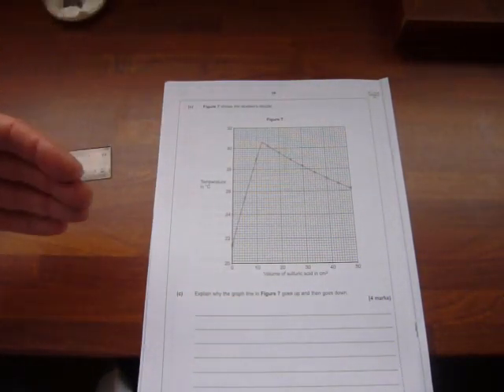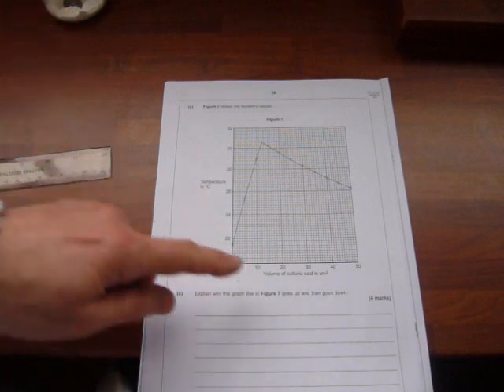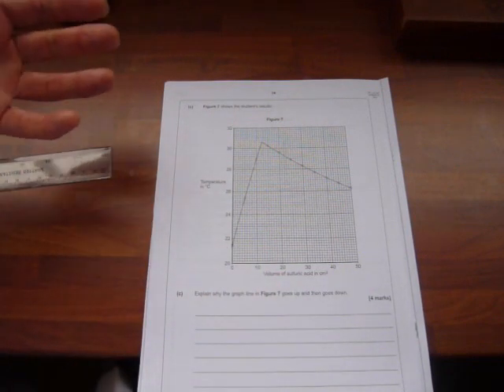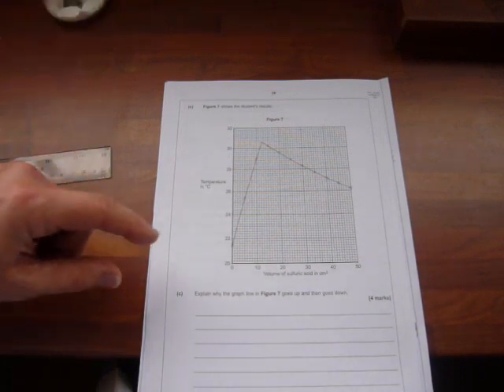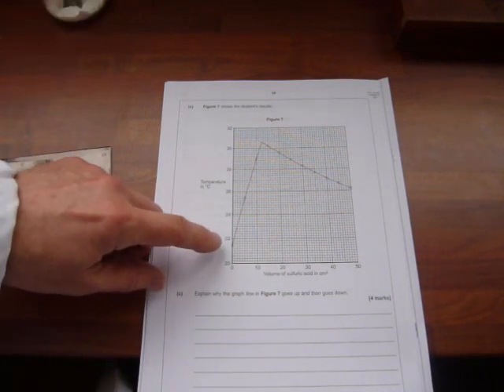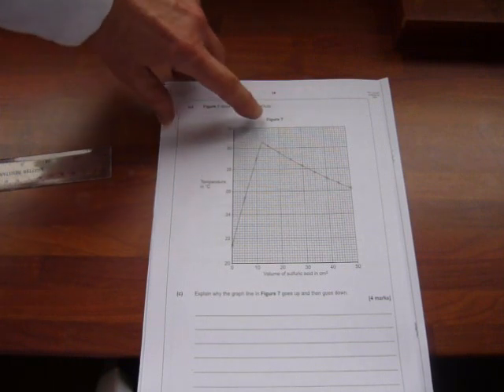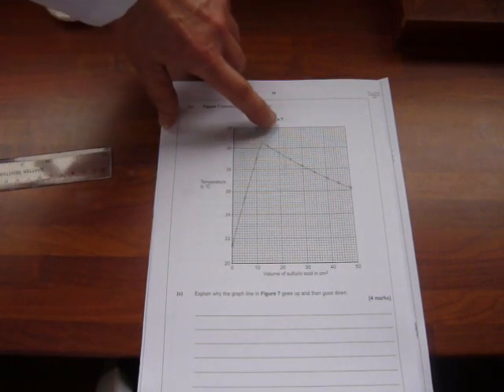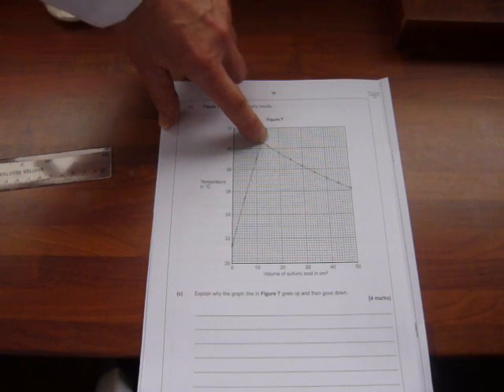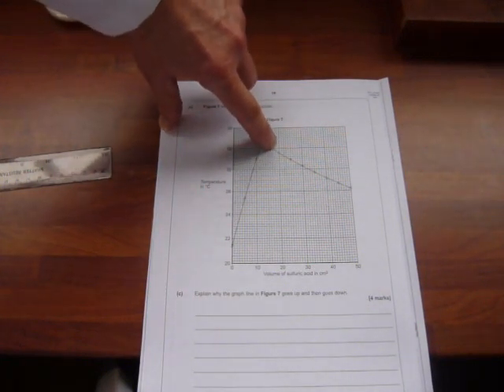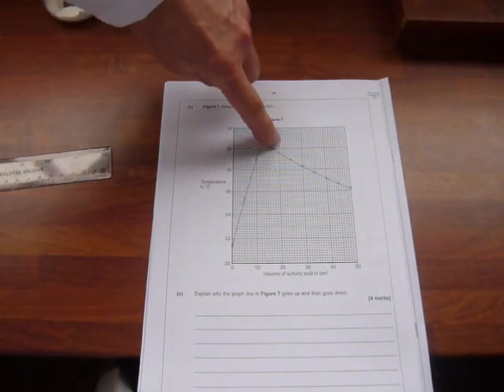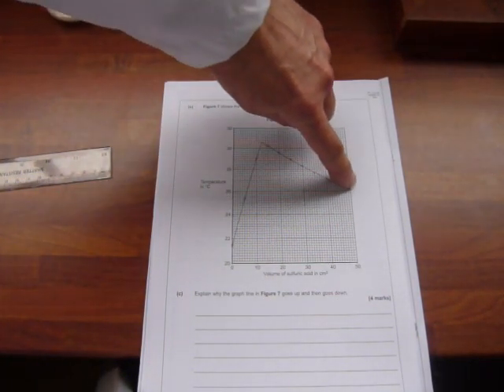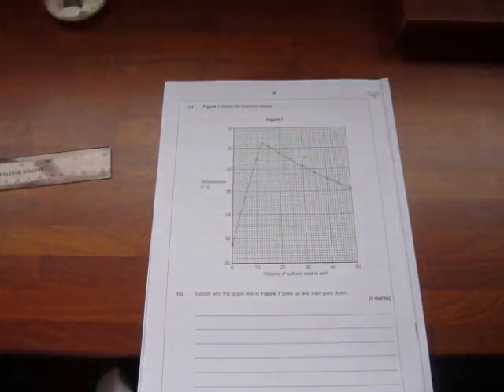But also, because you're adding a liquid, sulfuric acid, a dilute solution, that cool solution is going to be cooling down the reaction mixture quite significantly. So, once you've reached your highest temperature of 30.6 degrees, in this case, adding any other liquid is going to cool it down. There's no further reaction, because the sulfuric acid is in excess, and because it's a liquid at room temperature, it's actually cooling the overall mixture down.